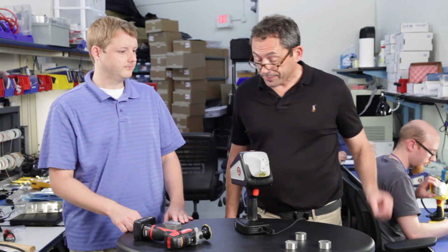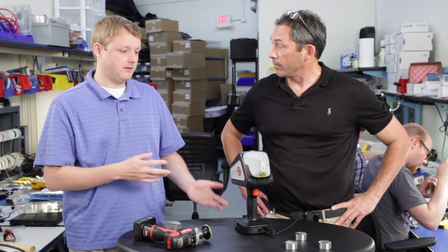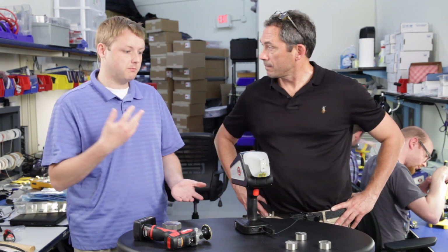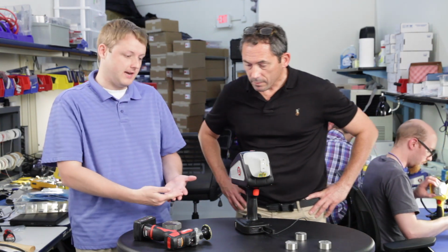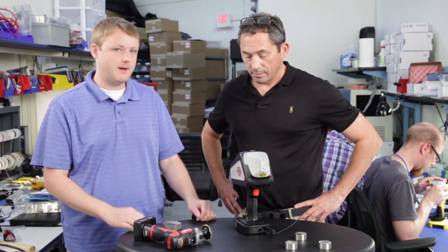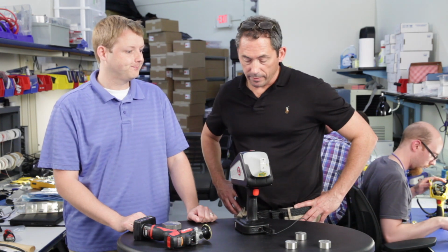Anything you'd like to add? I mean, no, we give you a lot of flexibility to have control over the data rejection, have control over how much pre-flushing you're doing with argon. You can control how many pre-burns the analyzer does, how long that pre-burn time is. So we give you a lot of options, just like an OES instrument. Yeah, it's great.